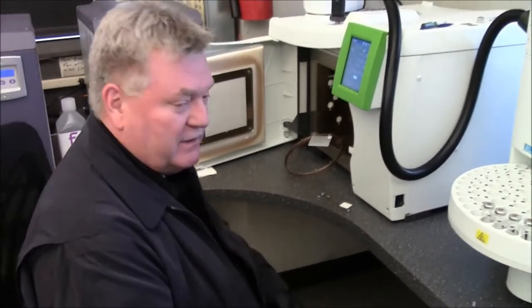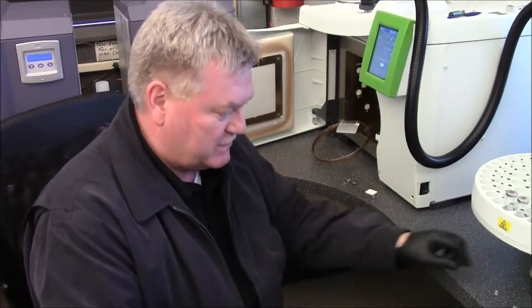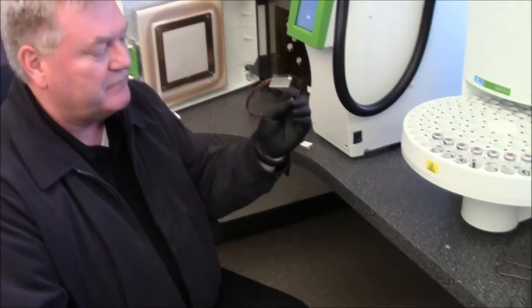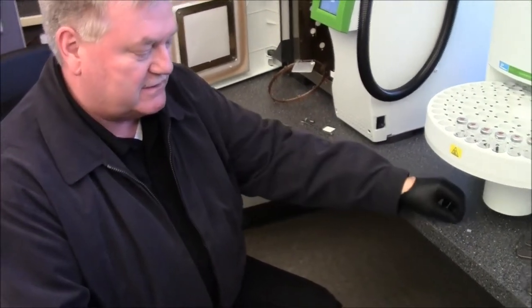Okay, first of all this is a new column. The one thing about a new column is you want to cut off a little bit on the front. You don't know what it's gone through. They always come with these little caps on them just to protect them because any kind of oxygen inside of them, especially if they get heated up with oxygen in them, it destroys them.